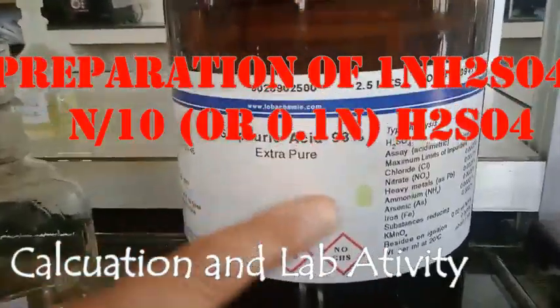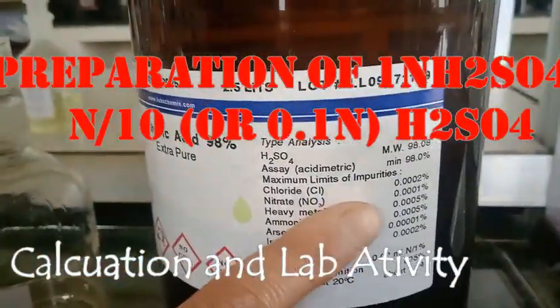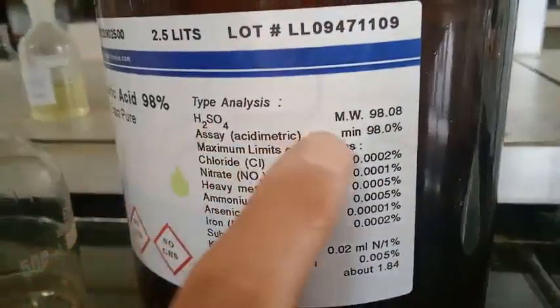Welcome back to Spectrum Classes. In this video we are going to prepare one normal sulfuric acid from concentrated sulfuric acid.